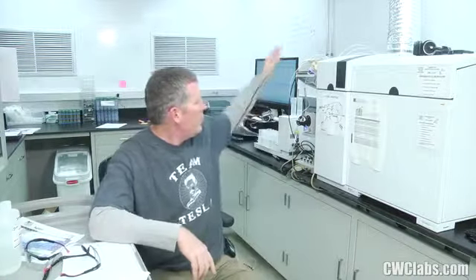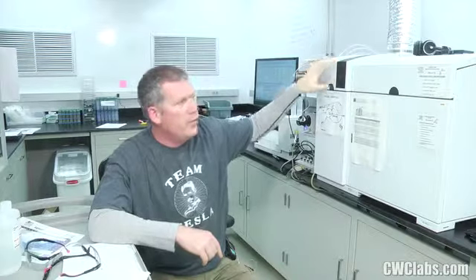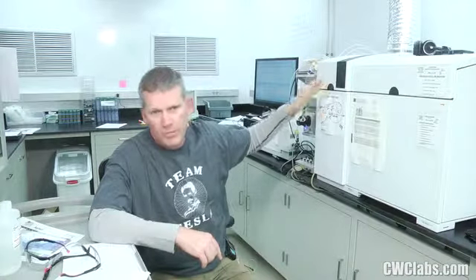And this is especially important if you're testing things like seawater, where you can salt up your sample cone very, very quickly. You've probably seen that. Or fertilizers, for that matter. I've done some of that, and oh my God, look at the sample cone. You're reducing all the wear and tear on your consumables at the same time that you're reducing argon usage by half, and effectively you're reducing the instrument usage by almost half as well. So you're getting just as good data.